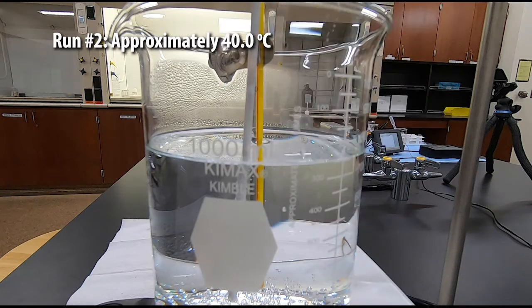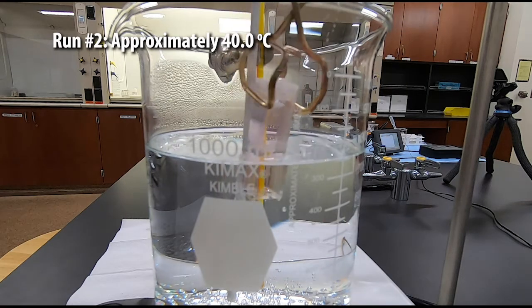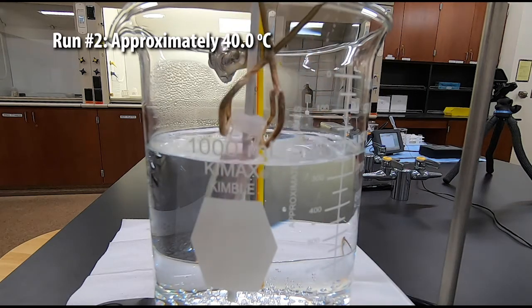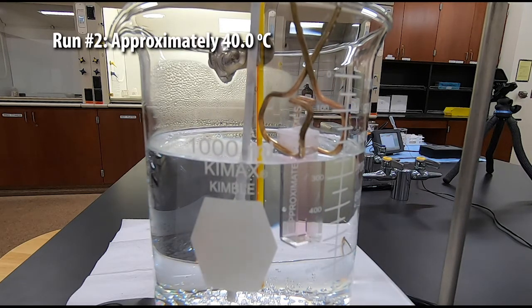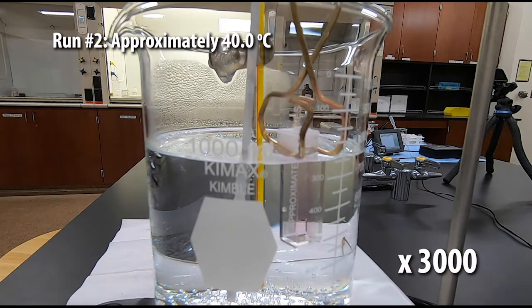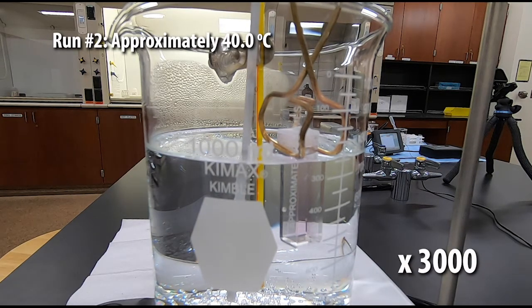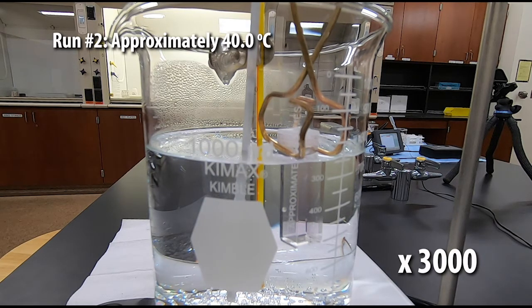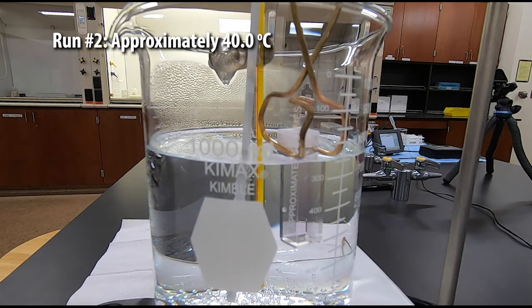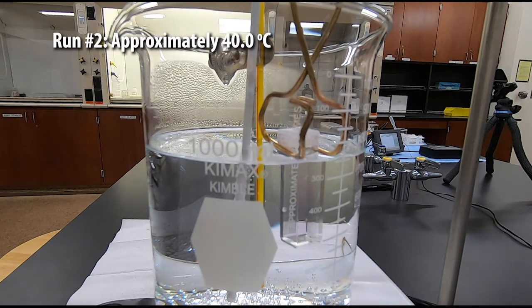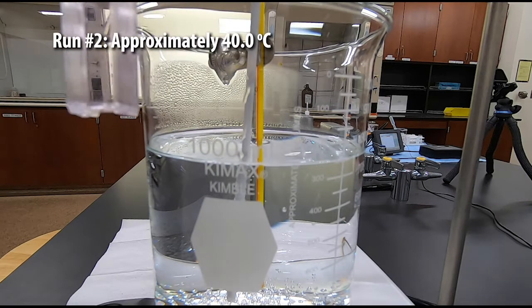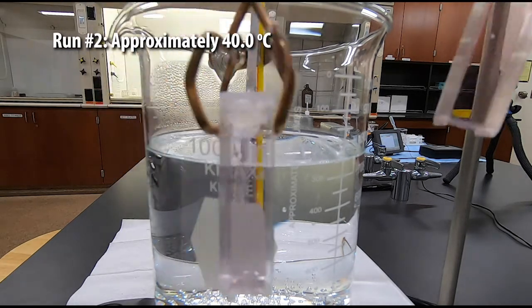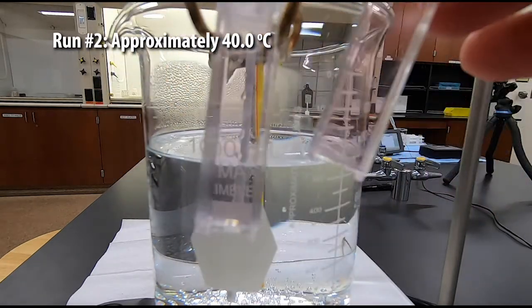Here is our solution before it goes into the water bath. This water bath is at approximately 40 degrees Celsius. We're going to leave it in here for five minutes to allow it to come to the temperature of the water bath. I'm going to speed this up, though, because obviously you don't want to sit here for five minutes watching this.